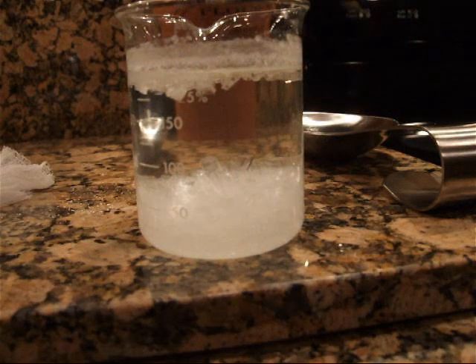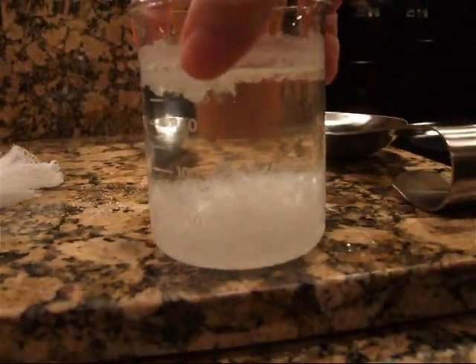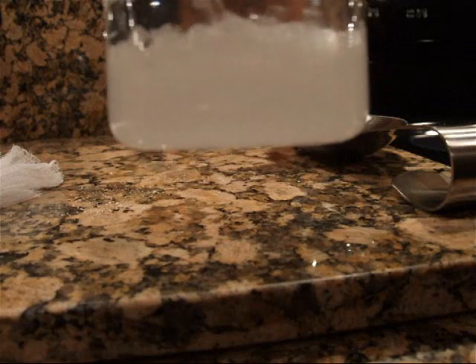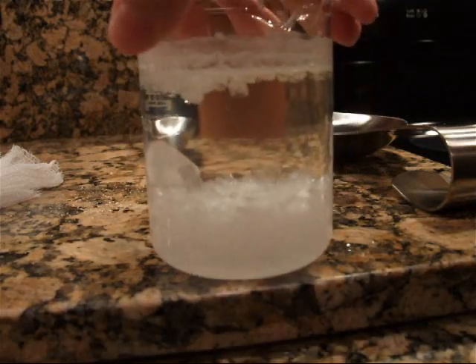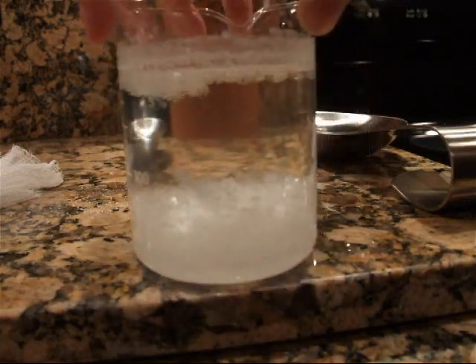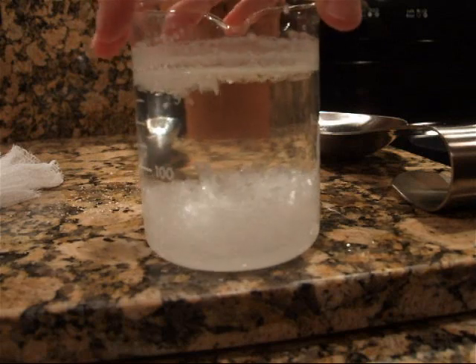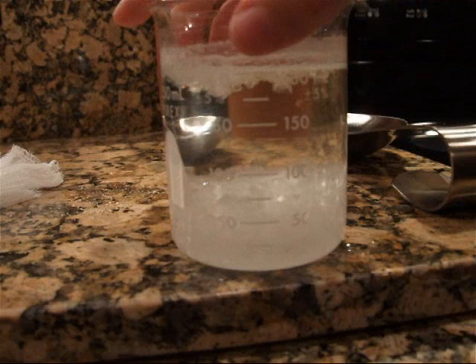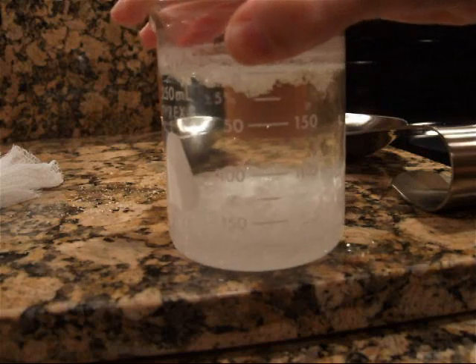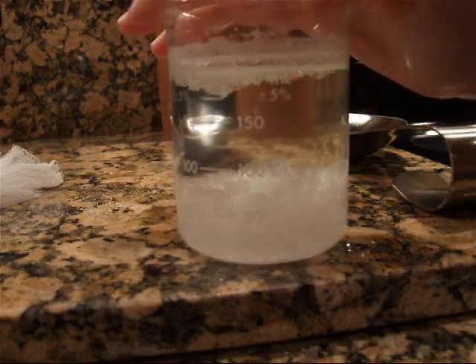Wanted to give you a little update — it's been about 10 more minutes now. Take a look. We've got a nice crystal growth there. Some really pretty ones in there, actually. We can just start the whole process over again if we just heat this up, melt them down, and start the whole thing over. Look at that one there — pretty awesome. Not as quick and dramatic as I wanted it to be, but it still gets the point across. Crystal growth is not just some random event.